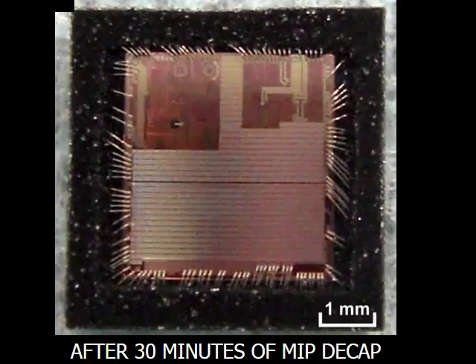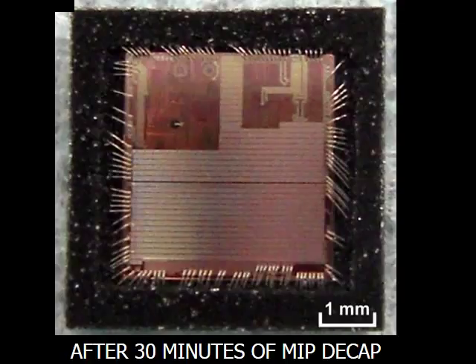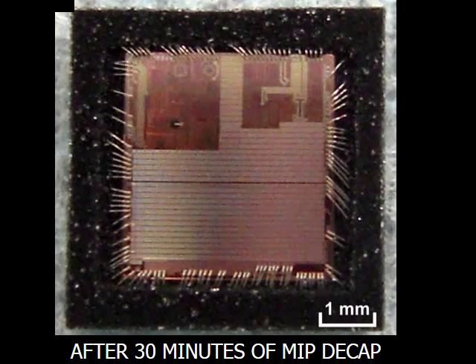This photo shows the same sample after 30 minutes of MIP decapsulation. MIP decapsulation has cleanly exposed the palladium coated copper bond wires as well as the silicon die. The sample is now ready for further analysis.